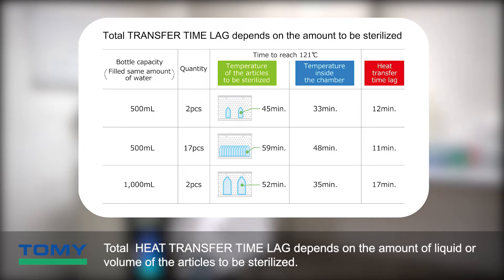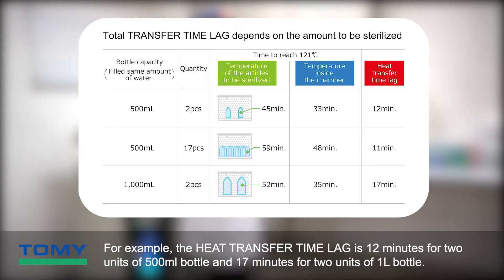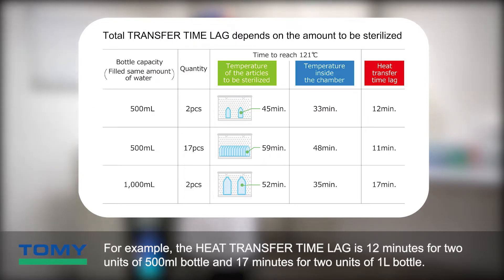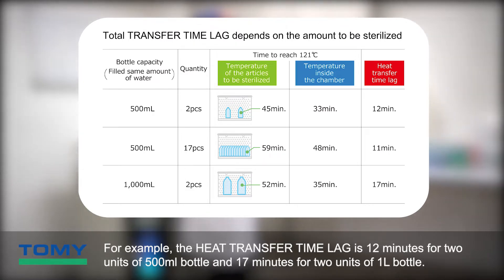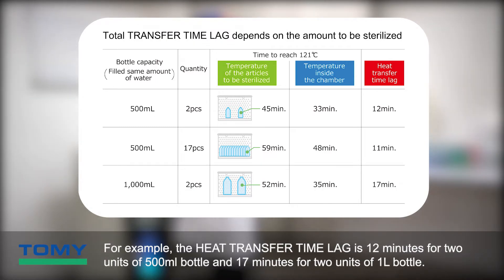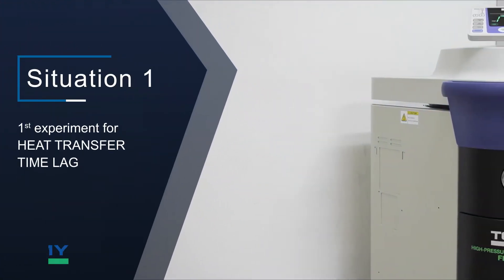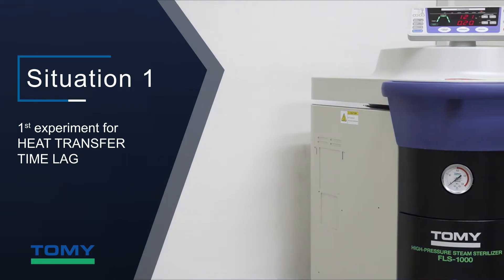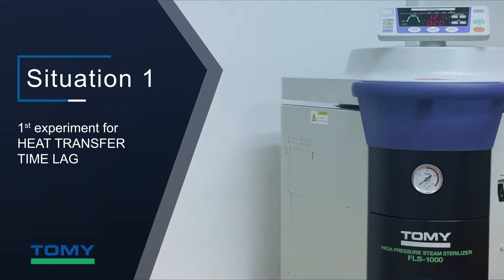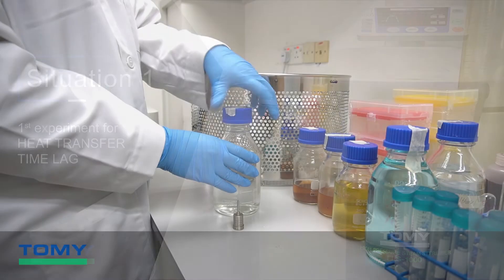Total heat transfer time lag depends on the amount of liquid or volume of the articles to be sterilized. For example, the heat transfer time lag is 12 minutes for 2 units of 500 milliliter bottles and 17 minutes for 2 units of 1 liter water bottles.